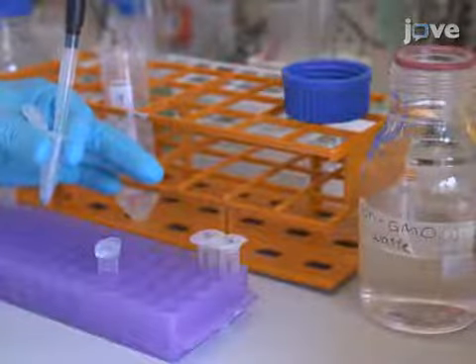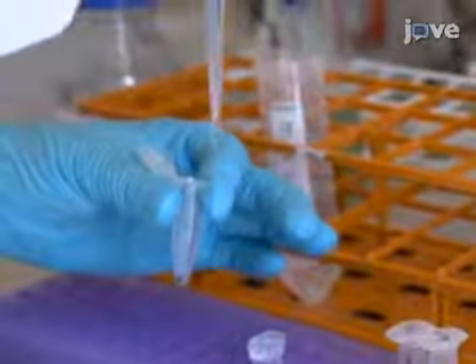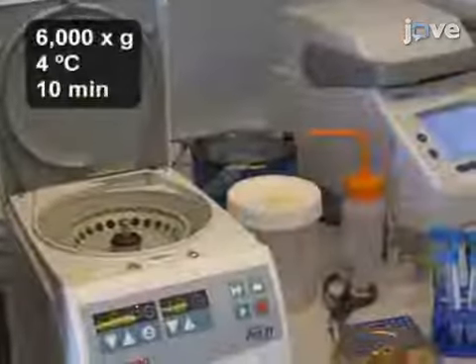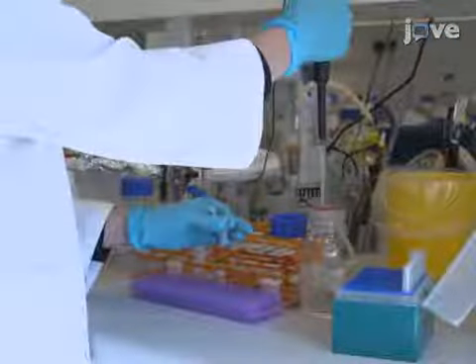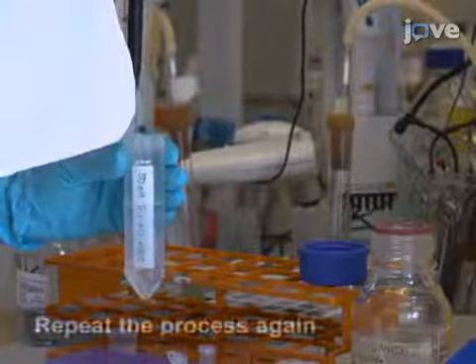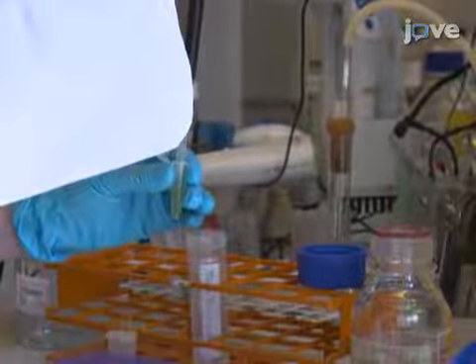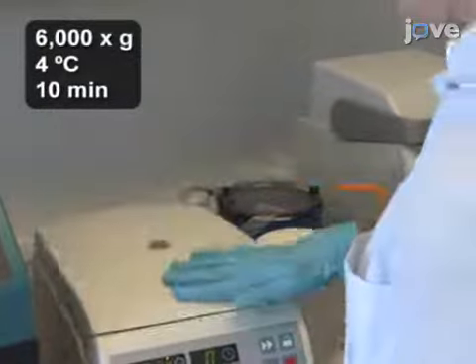Discard the supernatant before resuspending the pellet in 1 milliliter of 50 millimolar Tris-HCl pH 8. Centrifuge the resuspended pellet as before. Discard the supernatant and resuspend the cell pellet a second time in the Tris-HCl buffer. Centrifuge the tubes as before and discard the supernatant.